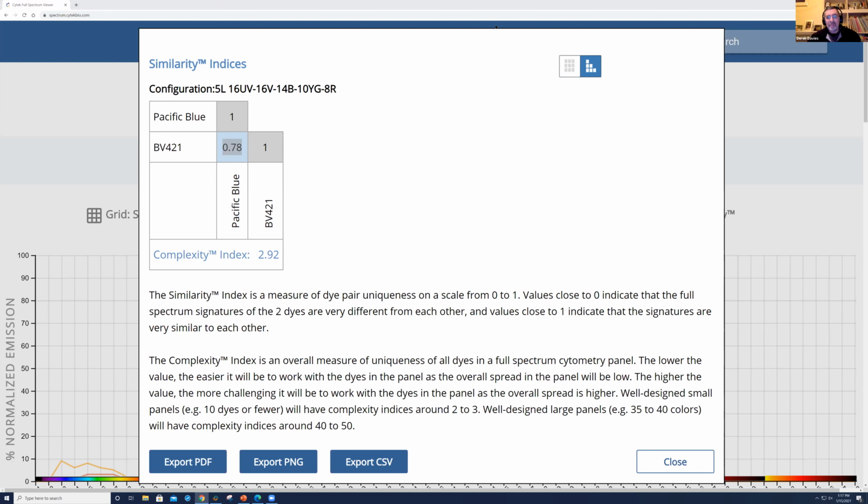Kathy, can I just ask a question? At that point, obviously we're using the Cytek Aurora because that's what you have in the lab, and we're using their full spectral viewer. Do other companies have something similar to that, that spectral viewer? Oh, to the spectral viewer, yes. There are other spectral viewers available. If you just simply Google fluorescent spectral viewer, there are a couple of different varieties that pop up from different vendors, and there's also one of my favorites that pops up for fluorescent proteins, since we see a lot of different fluorescent proteins, which is fpbase.org. They have one. There are ones from BioLegend, Thermo, BD, across the board. But specifically when talking about this similarity and complexity index for full spectrum flow cytometry on the Aurora units, that's where this one comes in handy.